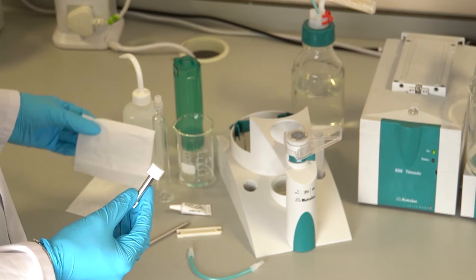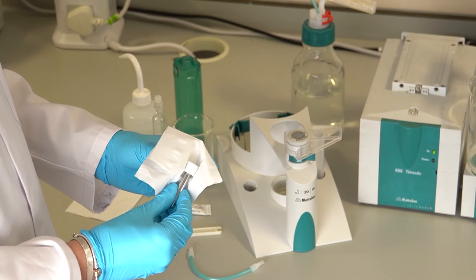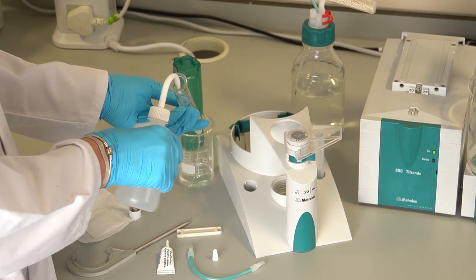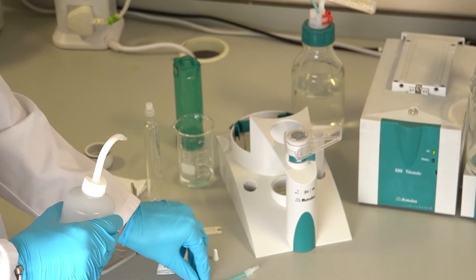Remove any residual grease from the piston. Rinse the glass cylinder and tubing with deionized water. A non-abrasive liquid cleaning detergent can be used to remove stubborn contaminants, but the cylinder then must be rinsed with copious amounts of water to remove any traces.